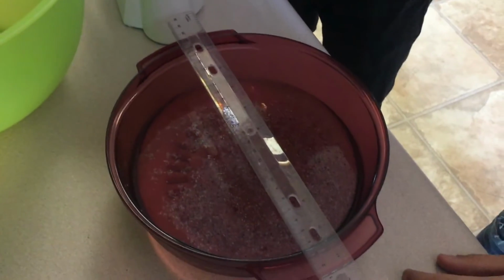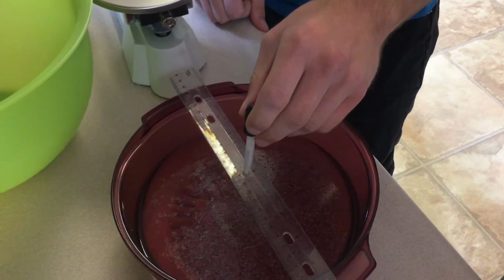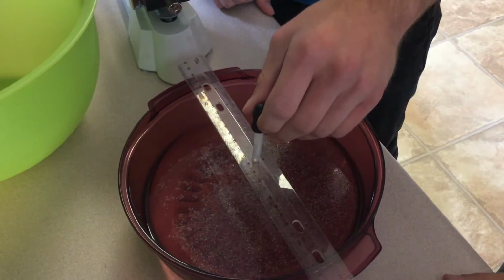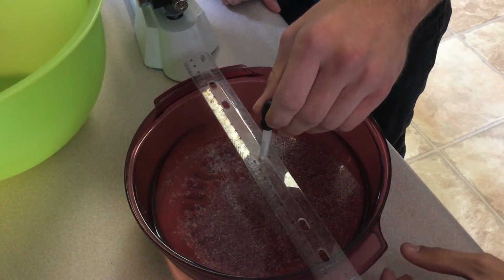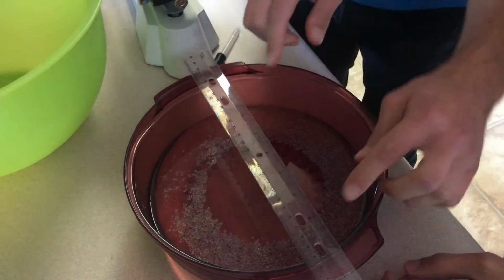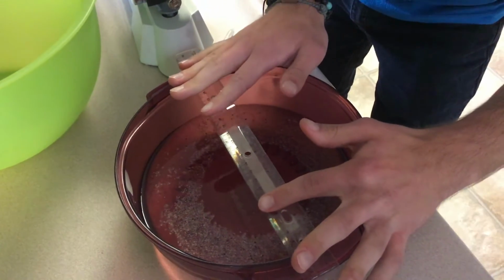I can see the pepper on there, and you're going to put one drop in there, and sure, perfect. And then just watch where you might want to use your fingers to show where your circle starts and stops. Okay. It was a little bit further out from where it is now.